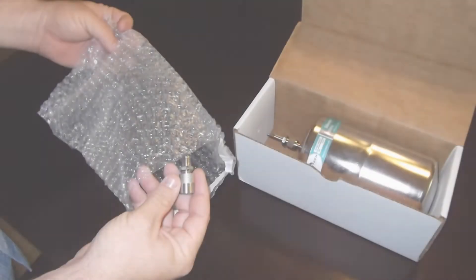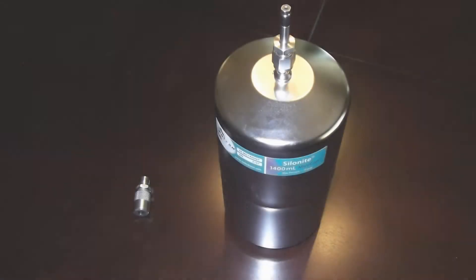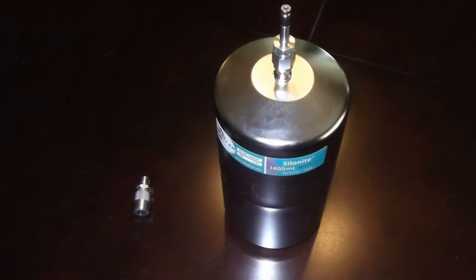Take out the grab sample adapter and remove the minican. When you are ready to sample, take the minican and grab sample adapter to the area to be sampled.